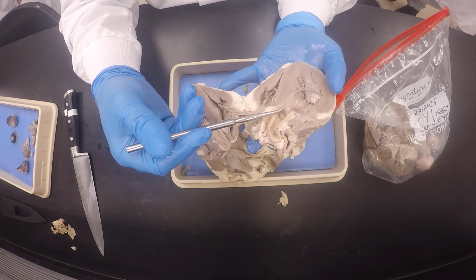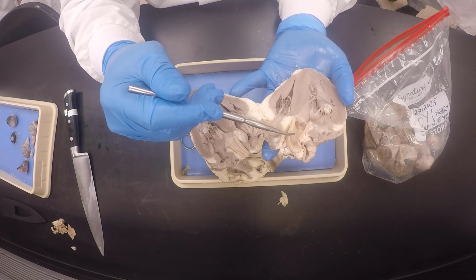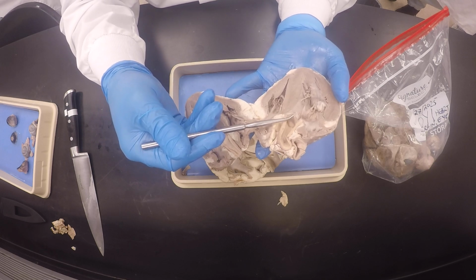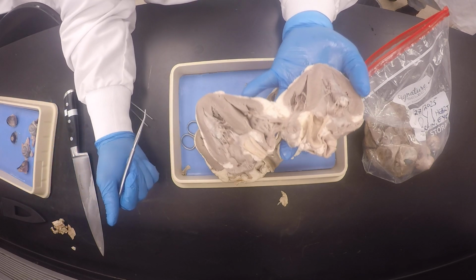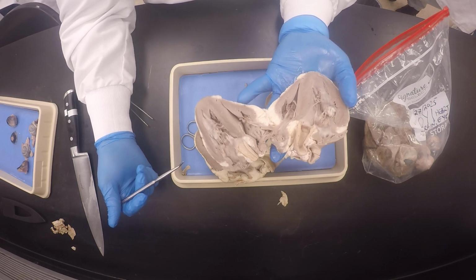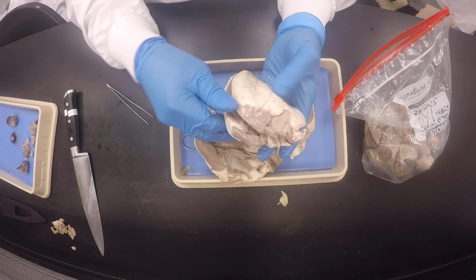You just said this is the aorta, so this is the aortic semilunar valve. Yeah, you've got to qualify that. If you just say semilunar, I'll be like, which one? Okay. And yesterday we did cut through this.